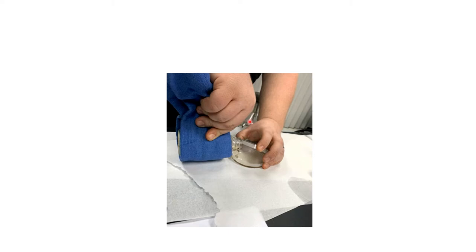Now they're doing an excellent job here. You see they have the lid of the agar plate up and being a sneeze guard basically over the agar. They've laid paper towels down on their table because this stuff is really hard to clean up. It turns into a solid when it dries, and so you've got this gelatinous goo to clean if you don't lay something down.